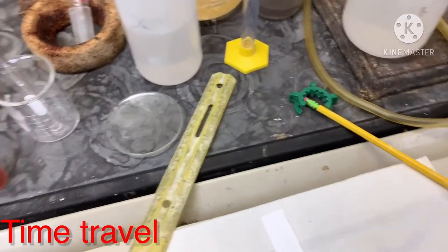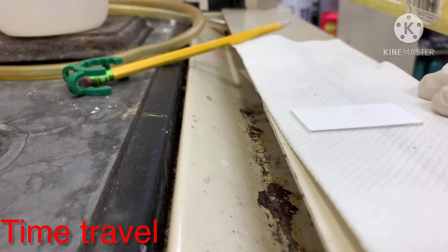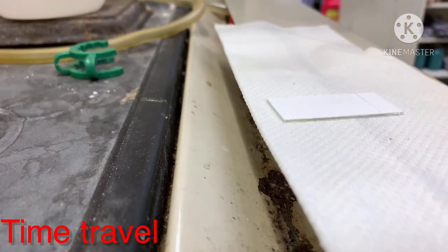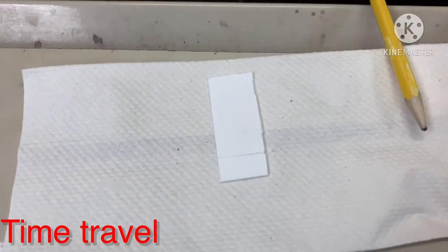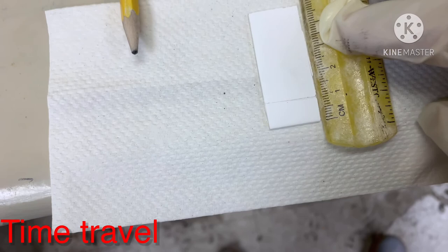Now I have taken a TLC plate. I will make a baseline mark with a pencil — remember, never use a pen, because pen ink is an organic compound that can dissolve in the organic solvent in the TLC chamber. Use a pencil, which does not dissolve in organic solvents. Make a light mark — do not press hard or you could damage the silica layer. The baseline should be one centimeter from the bottom of the plate.